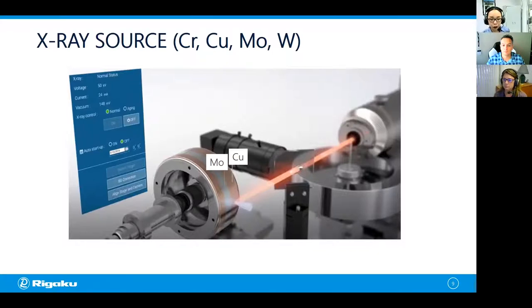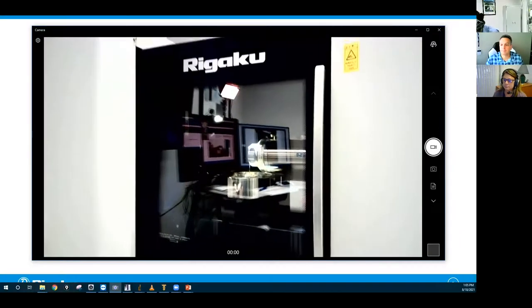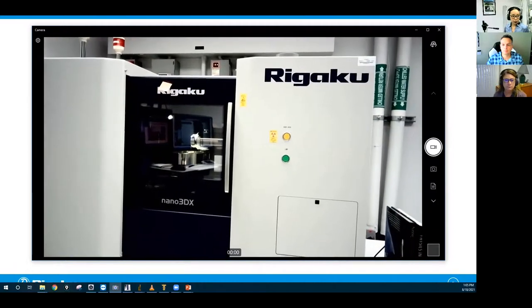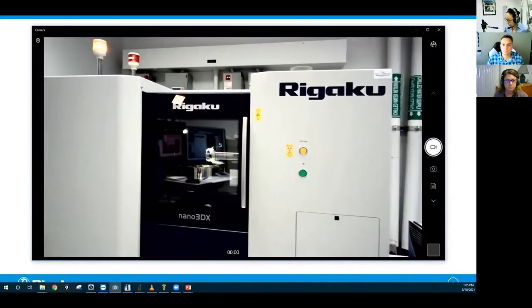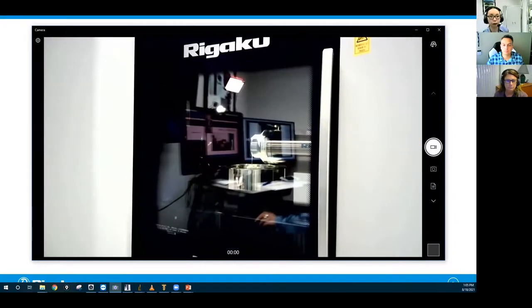Now I'm going to switch the view to the camera and show you the instrument. Do you see the camera view? We do. Yes. Okay. So let me step back a little bit. This is the Nano 3DX X-ray CT scanner or X-ray microscope we're using today, and let me get closer so I can open the door.